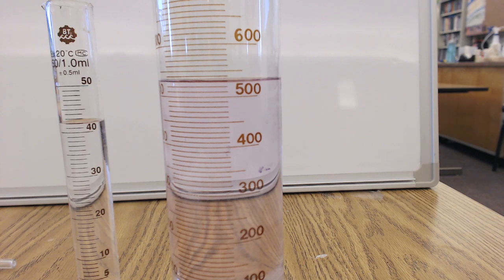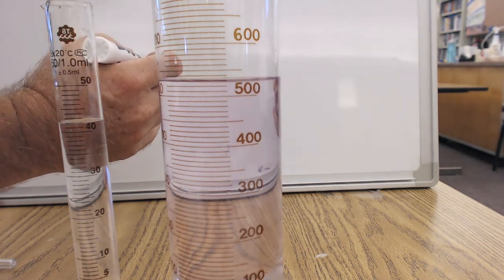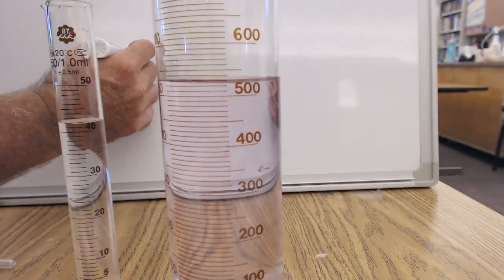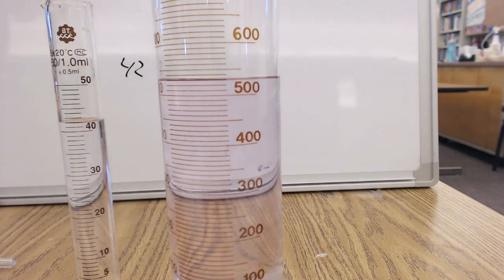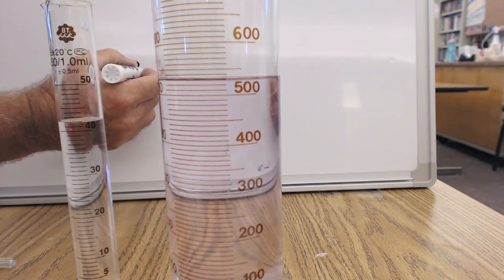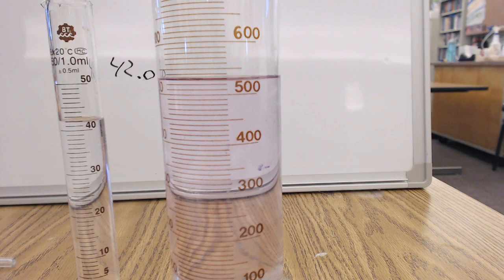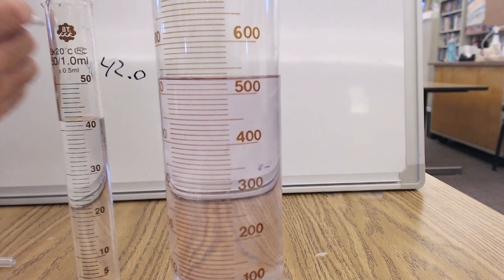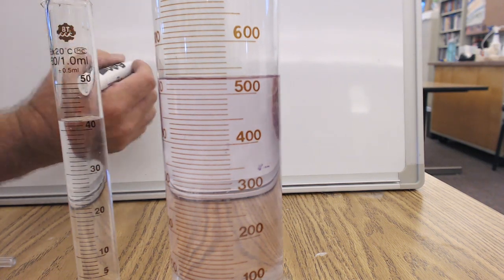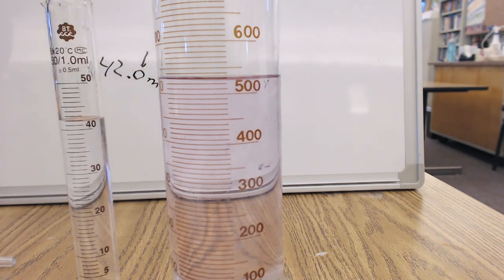In fact, every measurement you make is going to be a guess. So on this graduated cylinder, if I thought it was right on the 42, I should put, let's see if I can write it right here, 42 for sure. And I know the ones place, so I must guess the tenths place, and I think it's right on the line. So I'll put 42.0. And these are, if I look on the graduated cylinder, milliliters. That means I've guessed the tenths place.